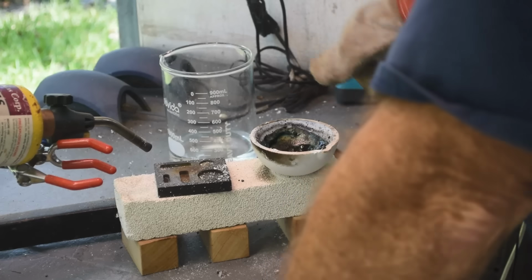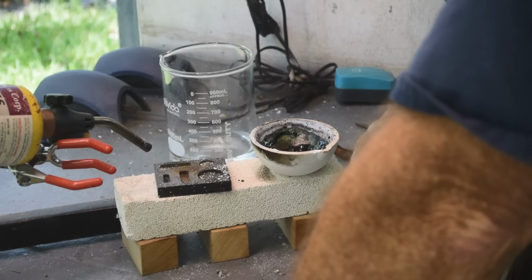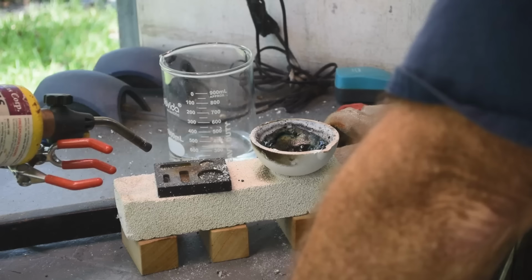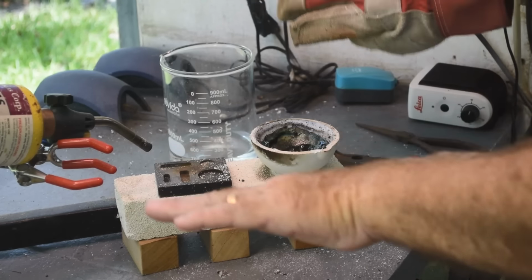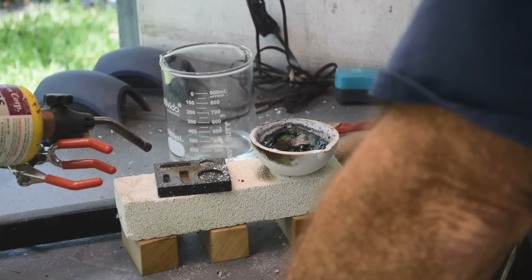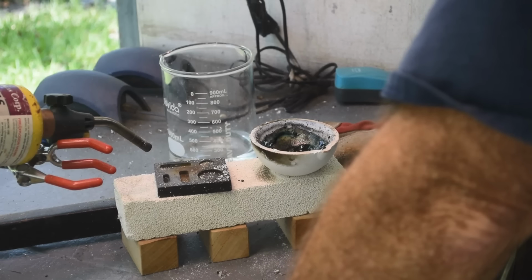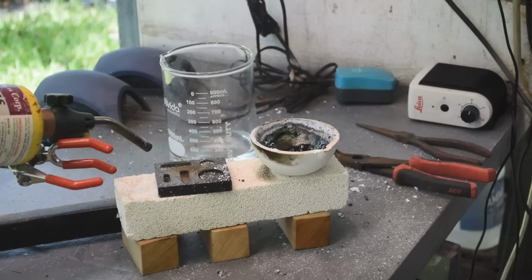Yeah, I mean, there's droplets all over inside here. I'll give you a close-up look at it here once it cools down a little bit. There's droplets all over inside the crucible. And if I hold the torch right over one of the droplets, it'll melt. It'll take a few seconds, but it'll melt. And then it'll flow away from the torch, and then it'll immediately harden again. I just can't seem to get this hot enough to melt it all into one bead.